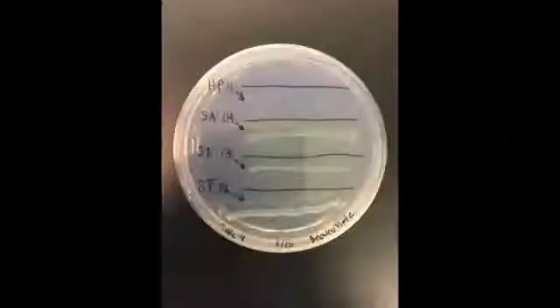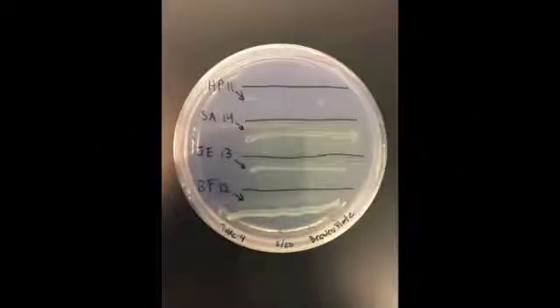After the incubation period has completed and you have verified the resazurin indicator strip has turned from pink to white, you can then analyze the growth on your plate to help determine your microorganism's oxygen requirements.